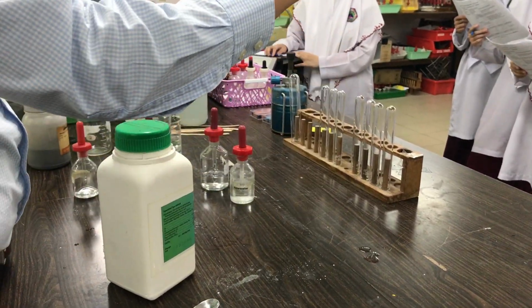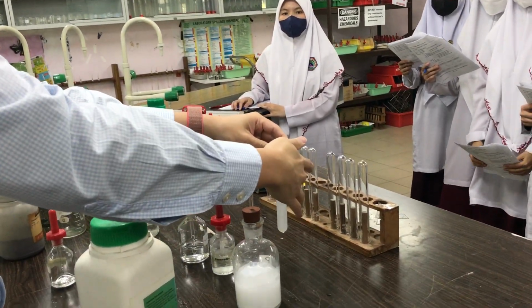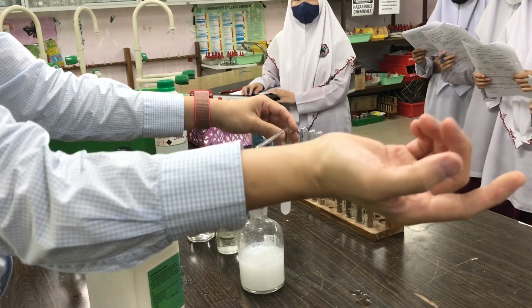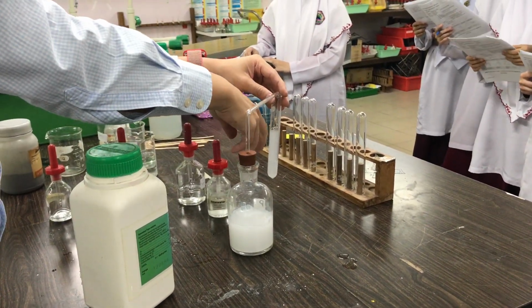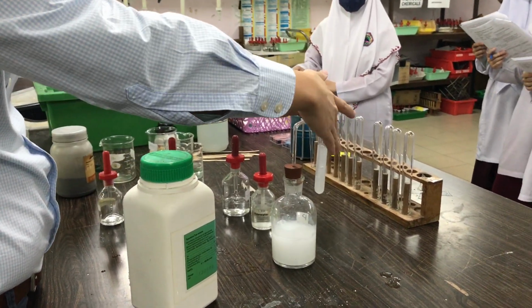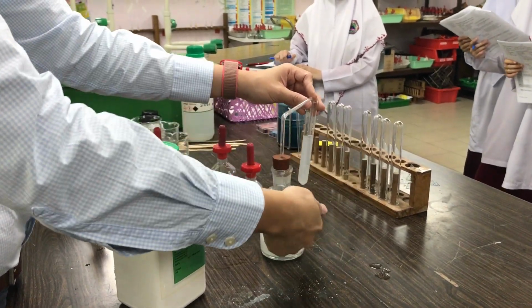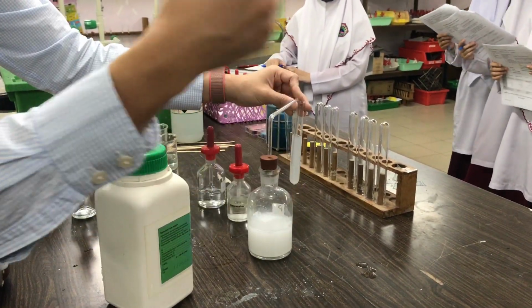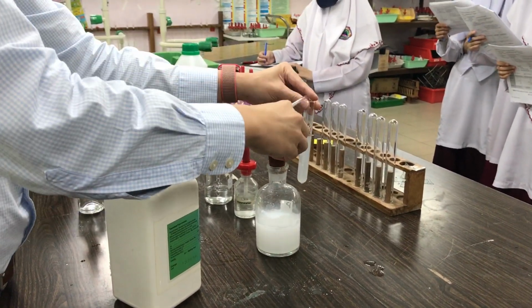This is the apparatus setup, yeah? Look, this is a glass tube. This was a test tube filled with lime water, which was a solution. That was what Nasrul held just now, right? And then I bubble the gas in here, and it reacts with the lime water and it goes milky. The gas is carbon dioxide. The observation is lime water goes milky. What ion was present? Carbonate. The formula for carbonate is CO3 2 minus. The ion present is CO3 2 minus.